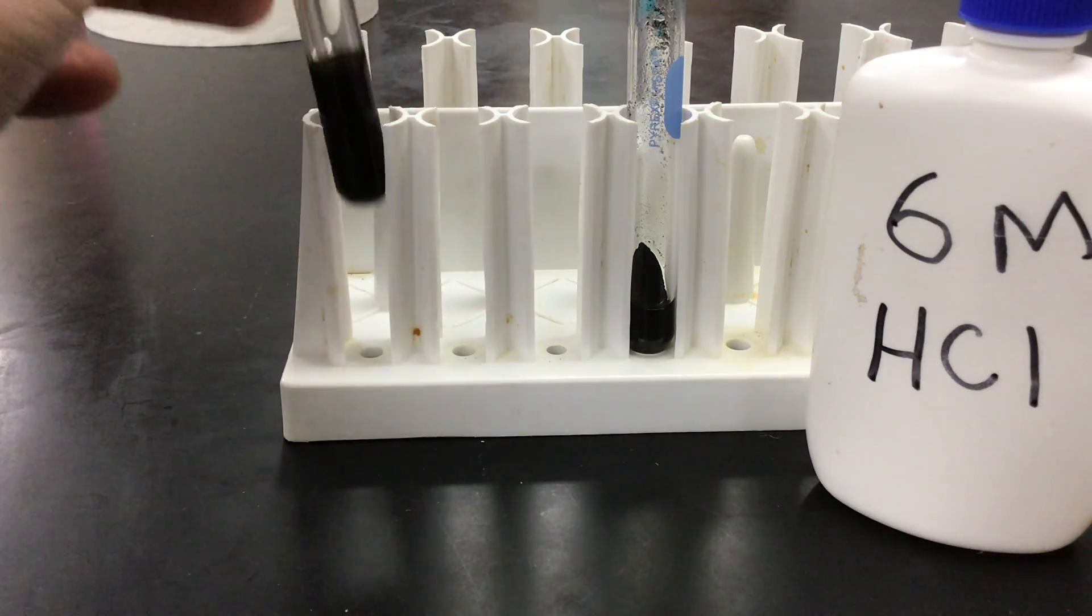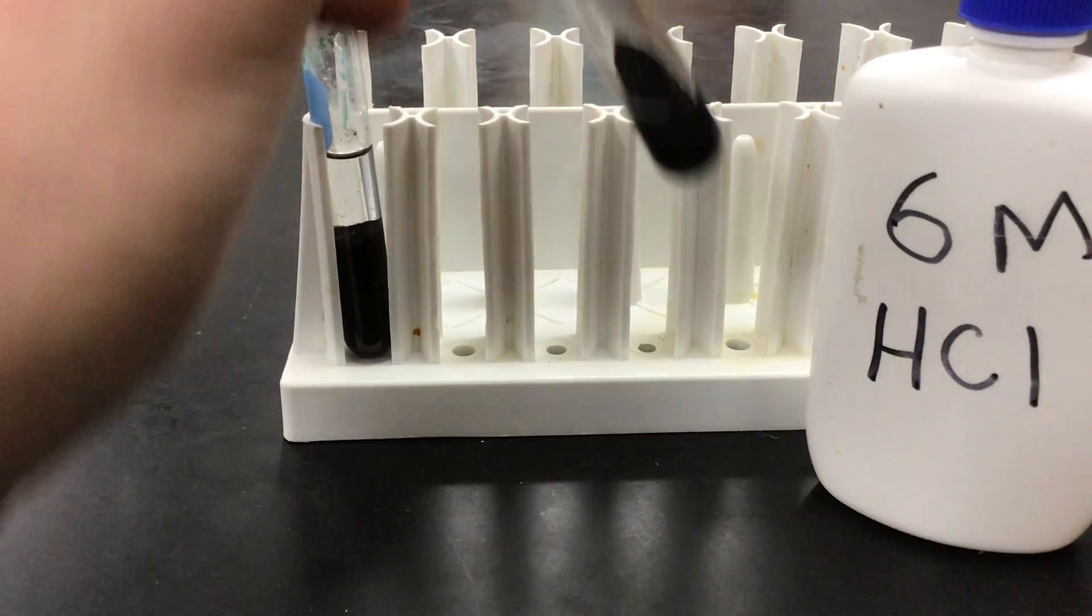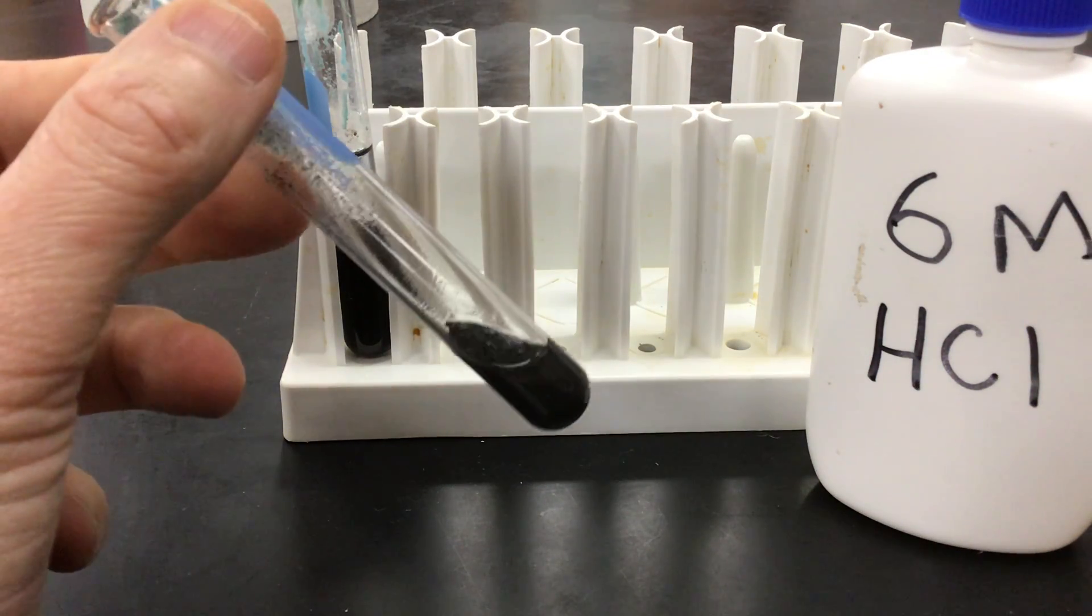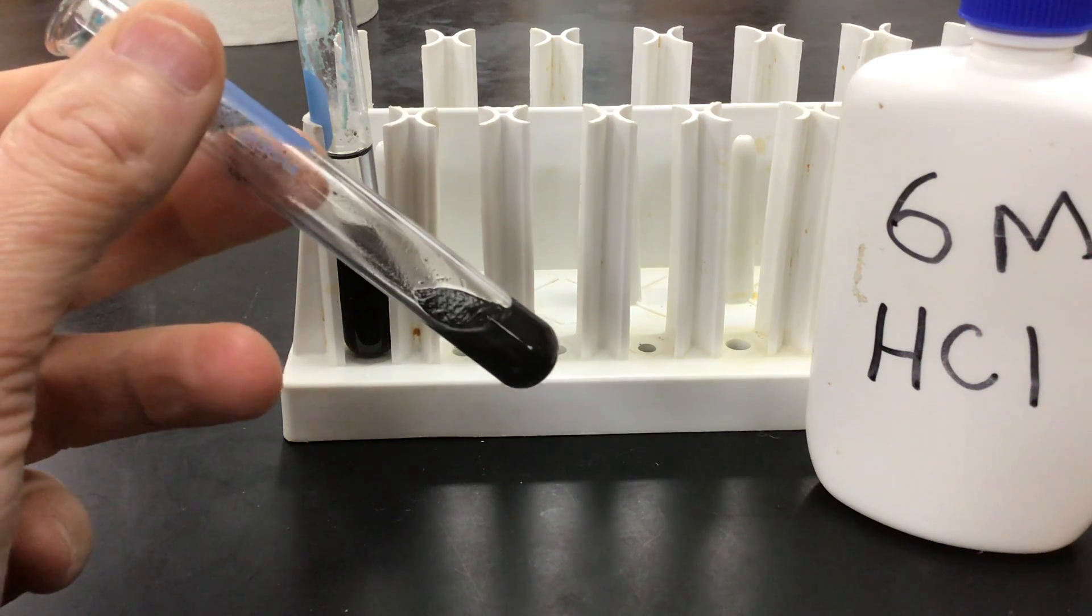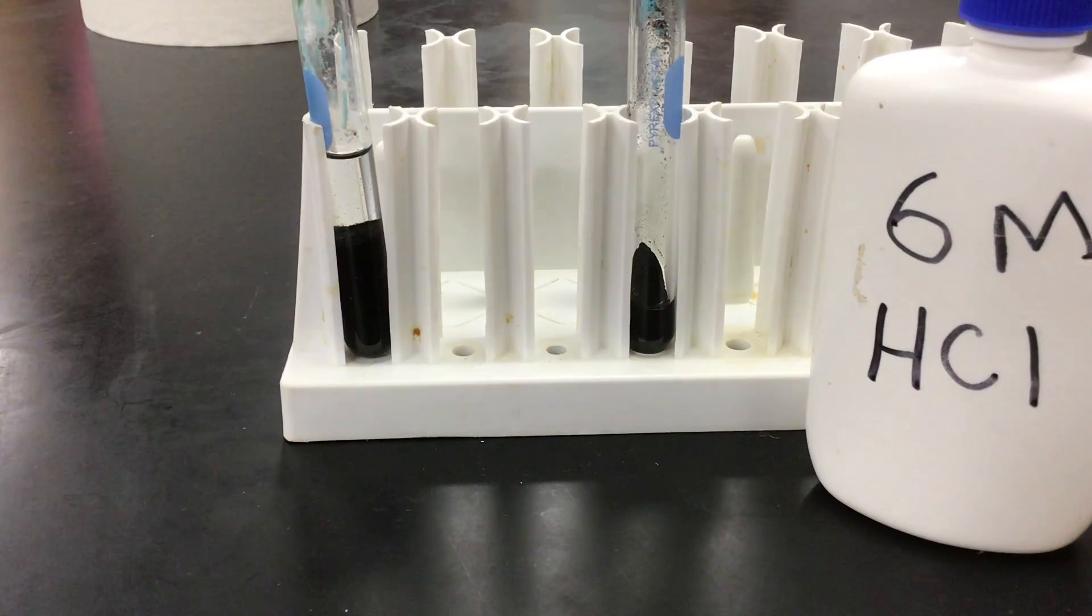I've centrifuged a test tube containing that substance because there's some remnants of sodium hydroxide present. I centrifuged it, decanted off the liquid, and then rinsed it a couple different times with water, and then decanted that off, leaving behind just the black solid.